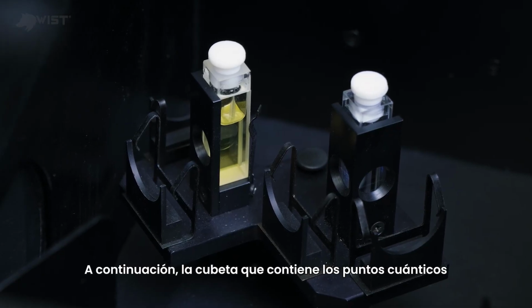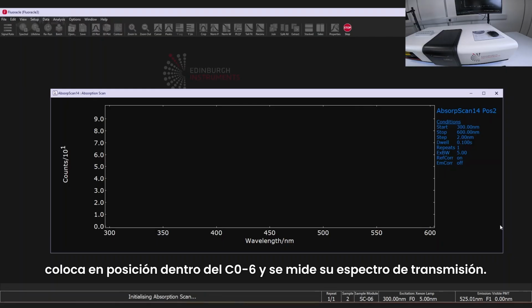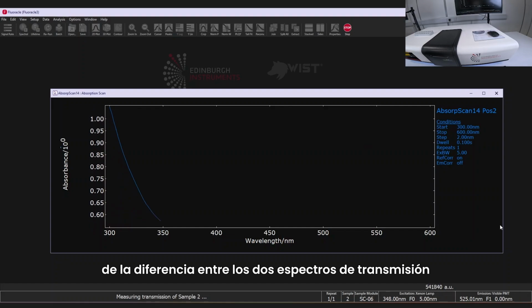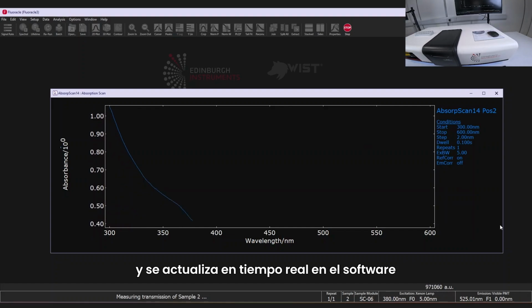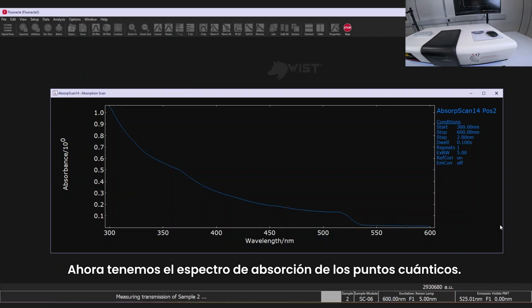The cuvette containing the quantum dots is now moved into position inside the SC-O6, and its transmission spectrum is now measured. The absorption spectrum is calculated from the difference between the two transmission spectra and is updated live in the software. We now have the absorption spectrum of the quantum dots.